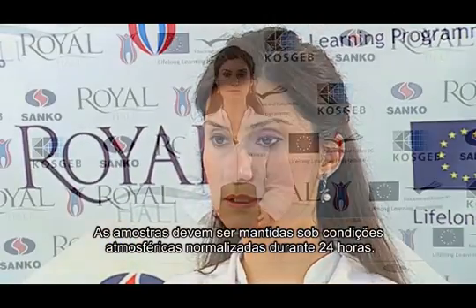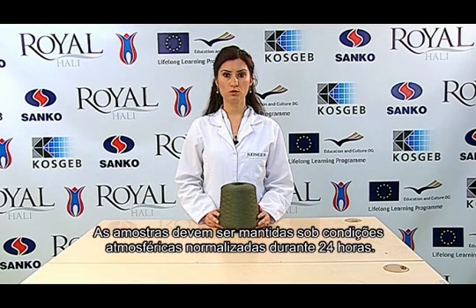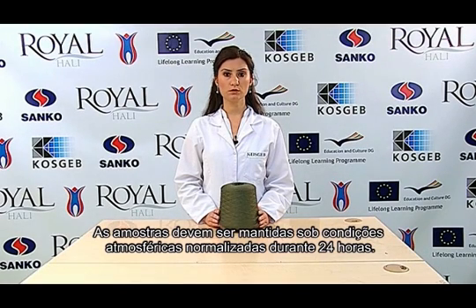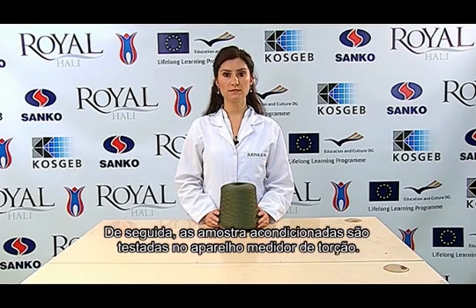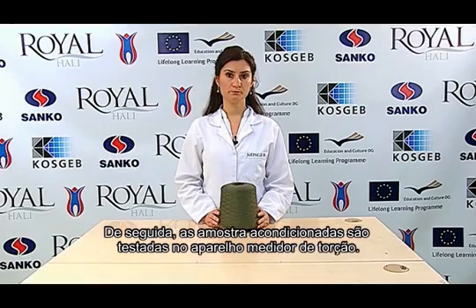Firstly, samples must be conditioned at standard atmospheric conditions for 24 hours. Then, the conditioned samples are tested in the twist measuring device.